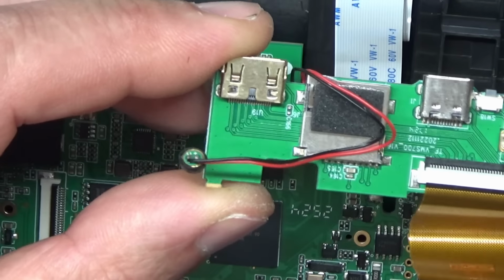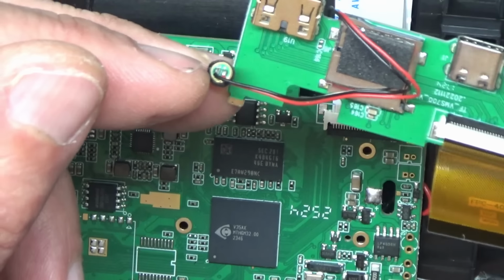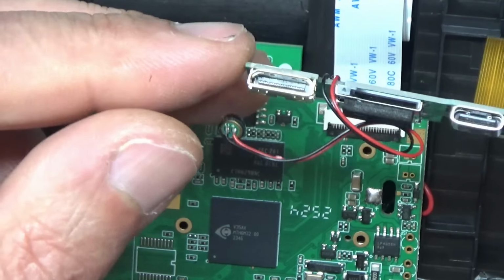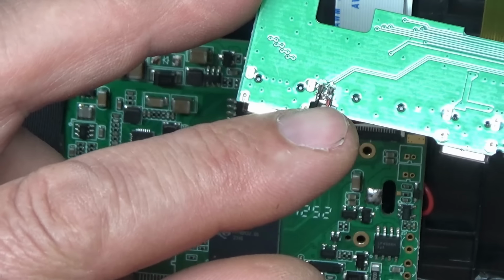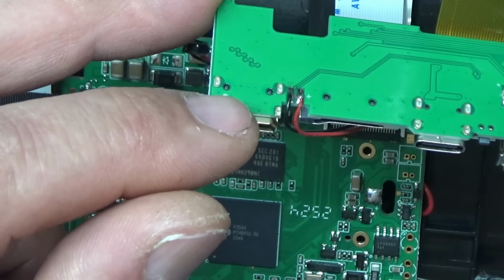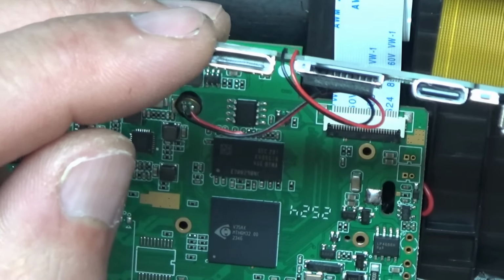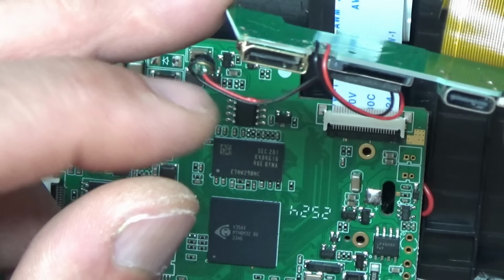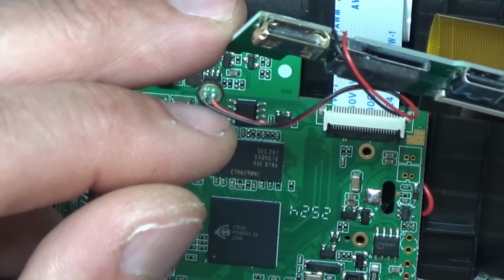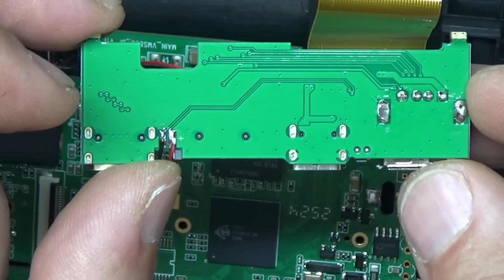So what I did was, when they said they could send us a board, I thought, well, I'll see if I could just alter it myself first. So I found an old microphone here and just coupled it up to these 2 points here, because that looked like where there was a microphone, or where there could have been a microphone fitted. But unfortunately it didn't work, so I guess it needed power, or a powered microphone to go there, which is a bit of a shame.